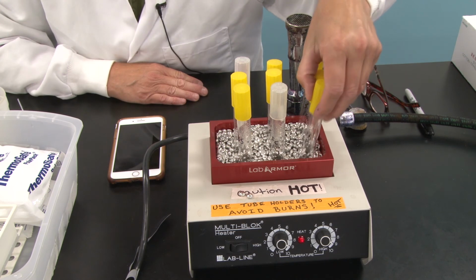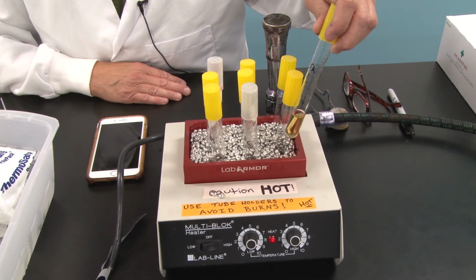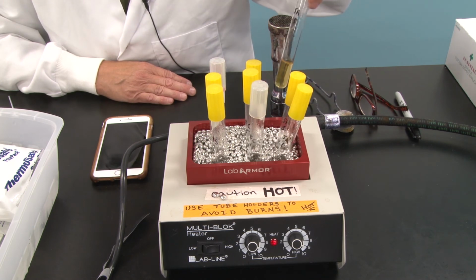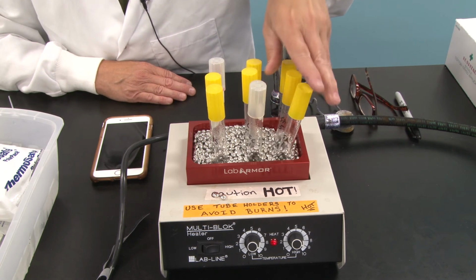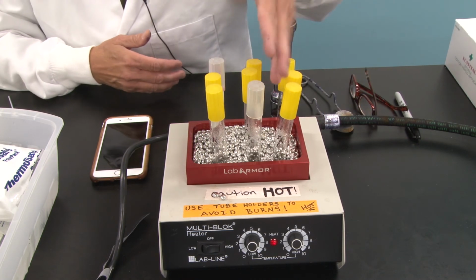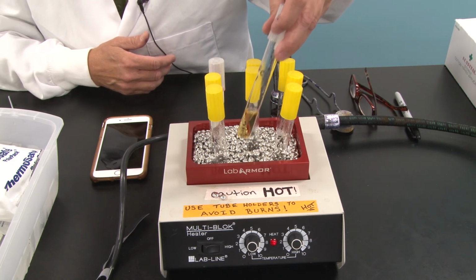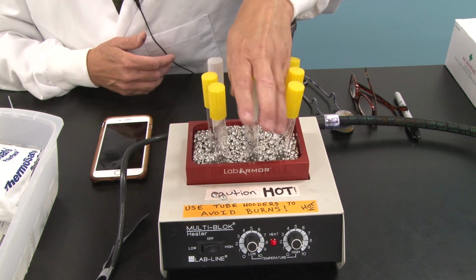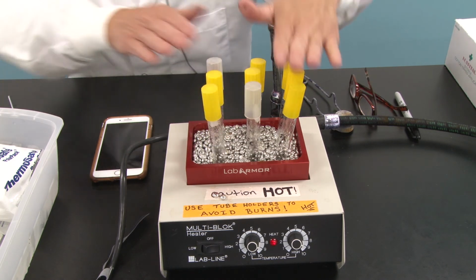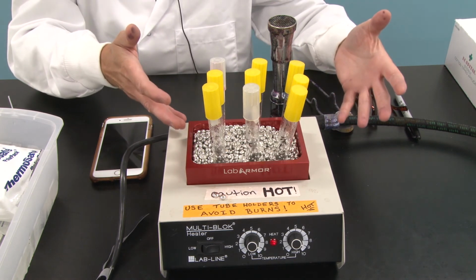The first 3 test tubes I've labeled with the organism I'm going to place in them, Staphylococcus aureus, SA. And they are labeled 1, 5, and 15. And those numbers represent the amount of time I am going to leave these tubes at that temperature once they have been inoculated. The second set here in the middle, they are labeled in the same way, 1, 5, and 15, but with the organism EC, or Escherichia coli. And finally, over here, we have Bacillus subtilis, 1, 5, and 15. So this media has been sitting for quite some time in this heat block. It's about 98, 99 degrees Celsius.